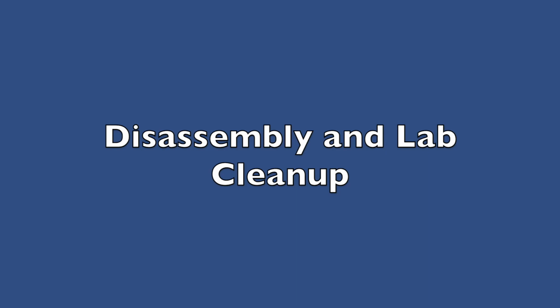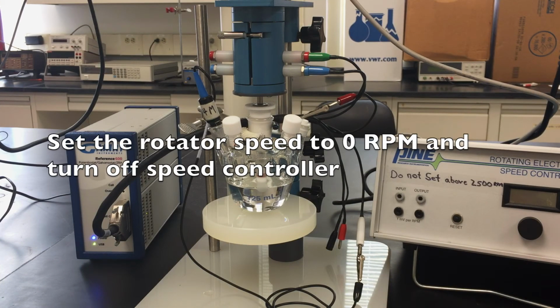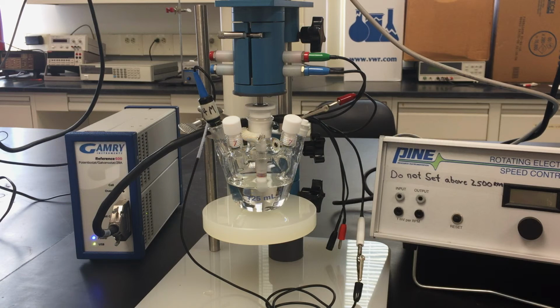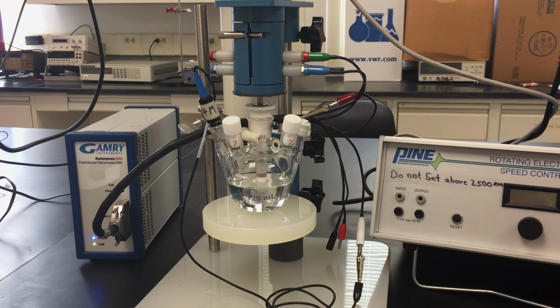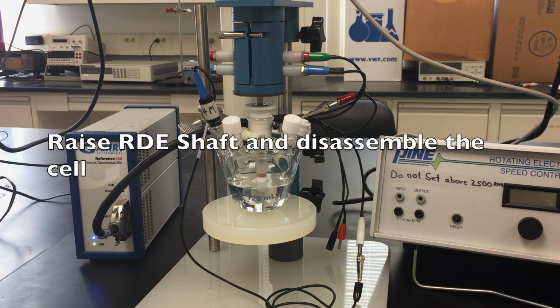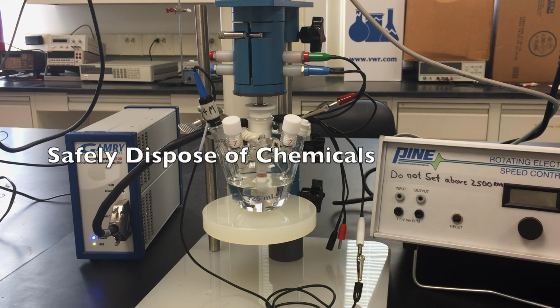Disassembly and lab cleanup. Before removing anything from the cell, turn the rotator speed to 0 RPM and turn off the speed controller. Next, make sure the potentiostat is not running any tests, then turn off the potentiostat. At this point, it is safe to disconnect all electric connections, remove the electrodes from the solution, and follow the standard practices of cleaning the electrodes and collecting all the rinsed solutions for safe disposal.